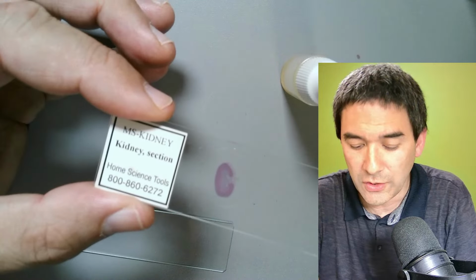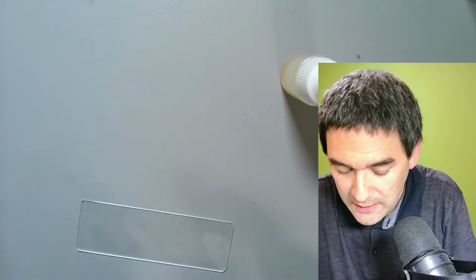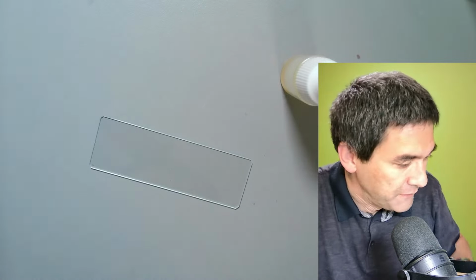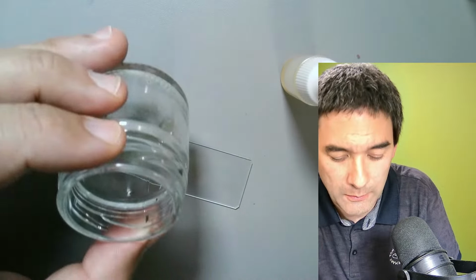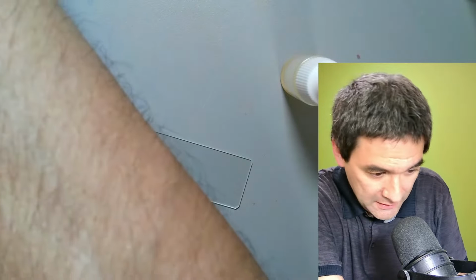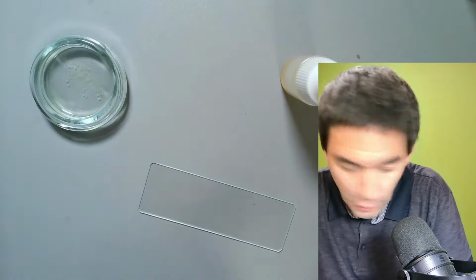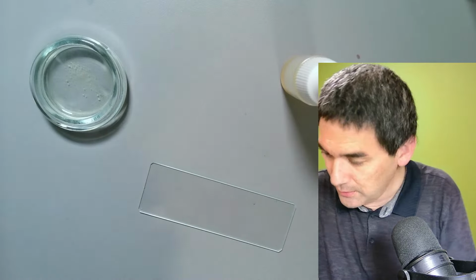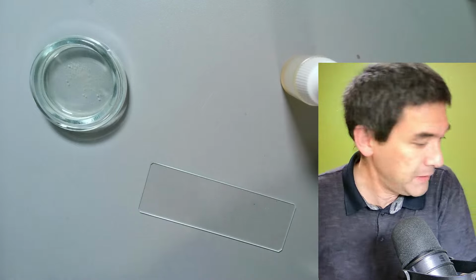So if you want to make a slide, here I've prepared a couple of samples. I've got some chlorella algae. I've got bacteria. Now you're going to say, oh, where did I get the bacteria from? I can show you if I can find it. Where's the bottle? Where's my bacteria?